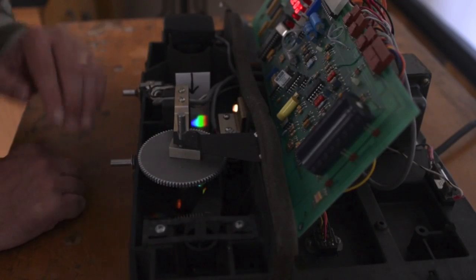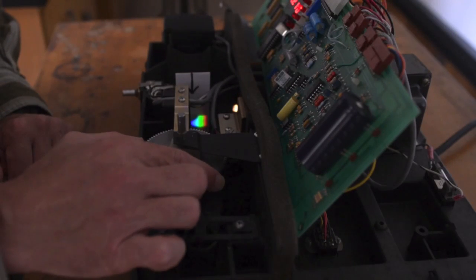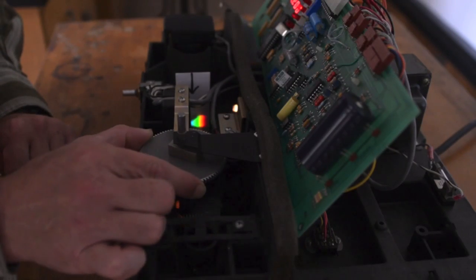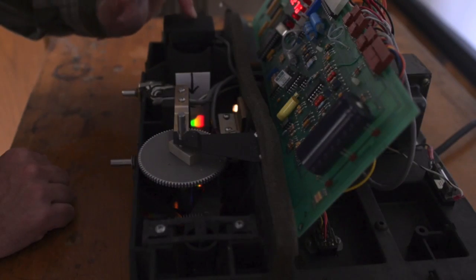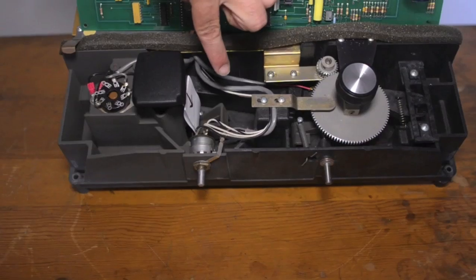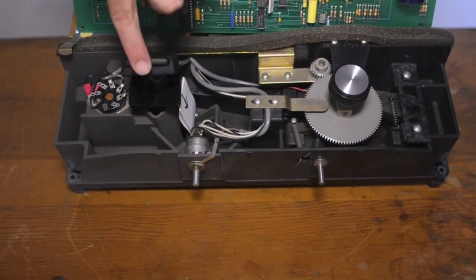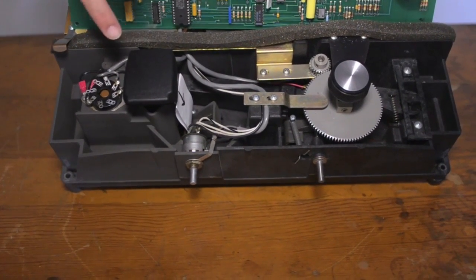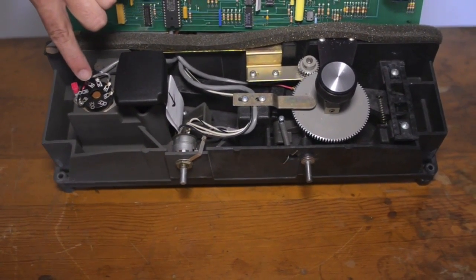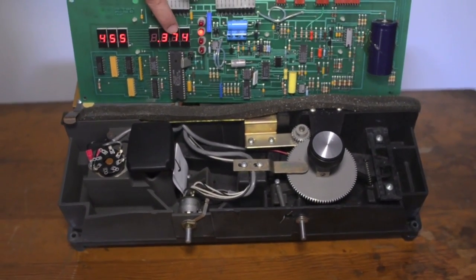From this angle, if you look right under the arrow, you can see that the grating has indeed broken the light into various wavelengths. As I turn the cam, you can see we are selecting for different wavelengths of light to send to the sample cell. The particular wavelength of light then makes it to the sample cell here. The sample will absorb a certain amount of the light. Any light that's not absorbed by the sample makes it to the detector. The detector then converts that signal into an absorbance reading, which you see here.